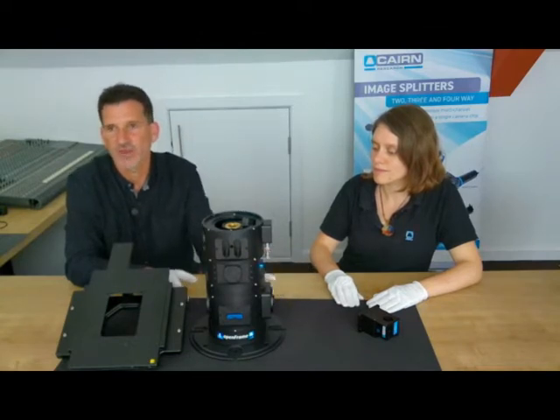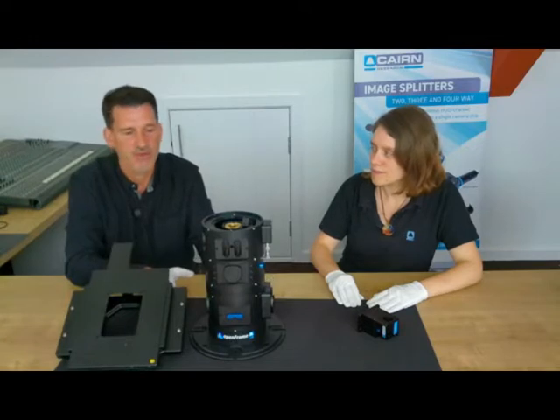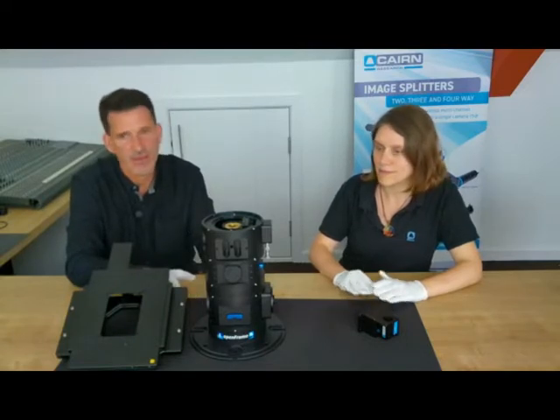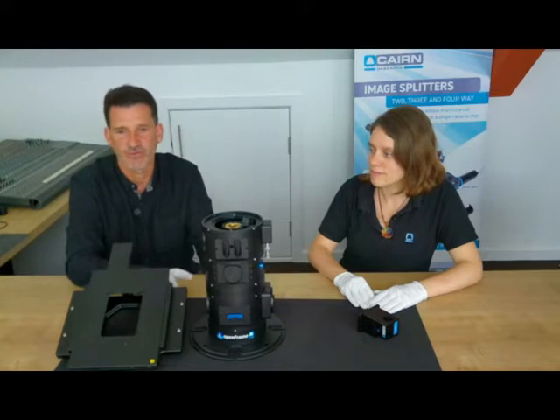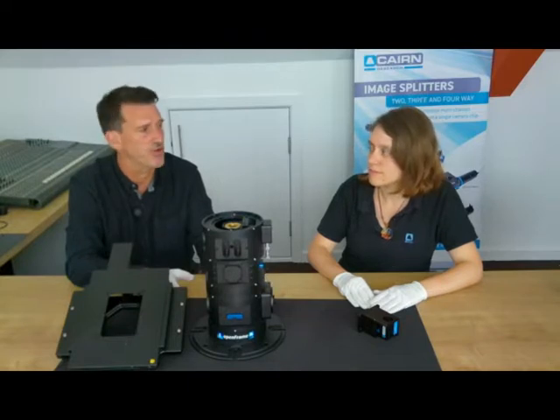So the whole idea is that we can really optimise everything very precisely if necessary, but of course for many wide-field applications you can just go with it, you don't need to do any of this stuff. So we've introduced the basic components. Now we're going to talk about a few of the modules that we've developed for the openFrame, and also some of our other components that we have used with conventional microscopes, but we are now using increasingly with this platform.